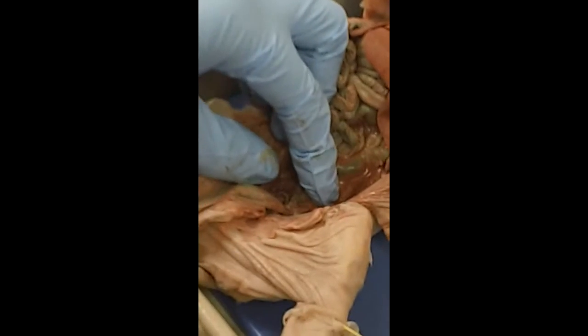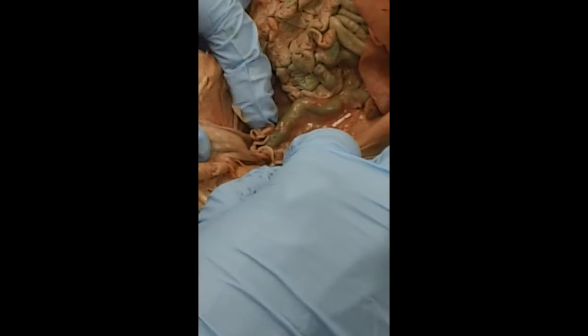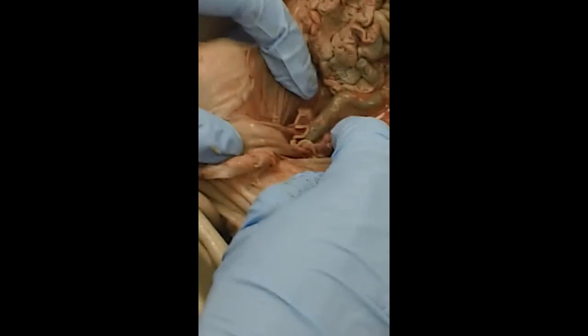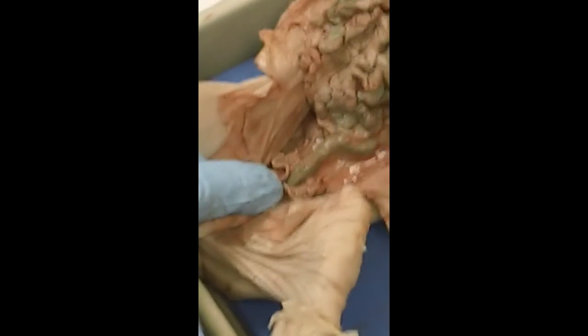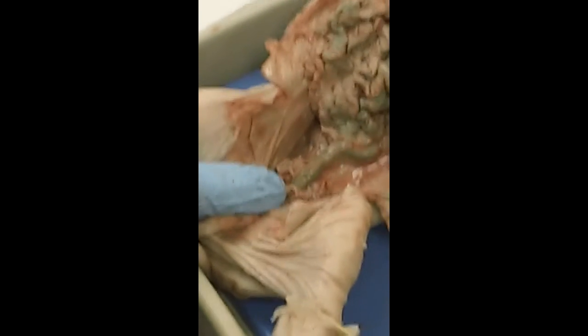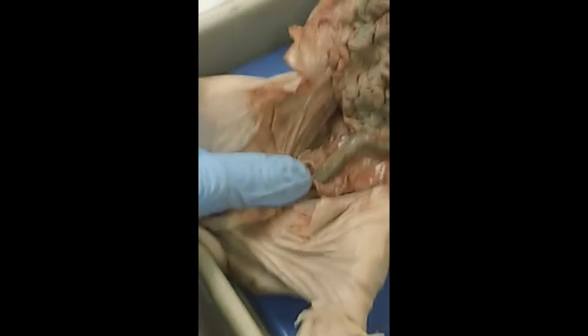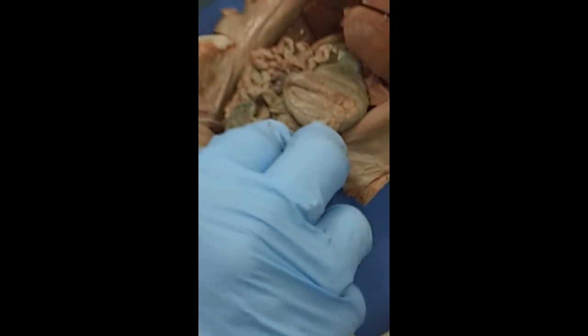Okay, reproductive. In the little girl, we have ovaries. There's an ovary there, there's an ovary there on either side. The ruffles are the fallopian tubes. So the egg is released by the ovary, travels down the fallopian tubes, and then where the two fallopian tubes meet, where the tip of my finger is, would be the uterus, and that's where the baby would develop. Okay, so that's reproductive in a female. You'll have to look at the reproductive of a male on the virtual side I gave you.